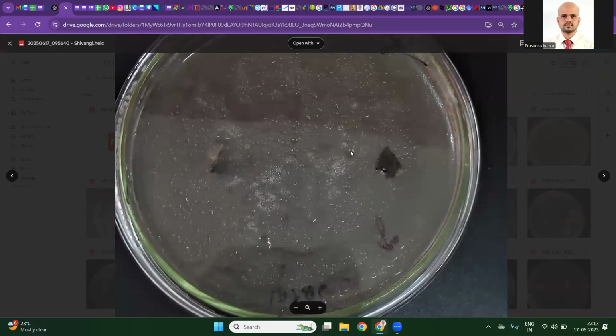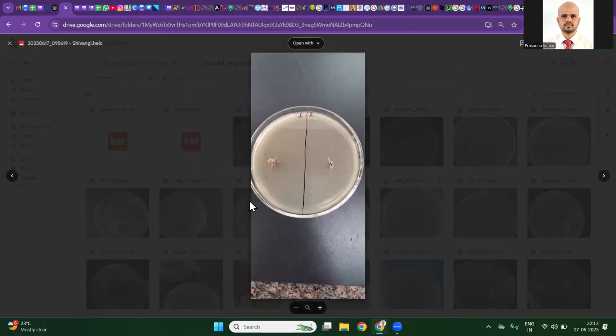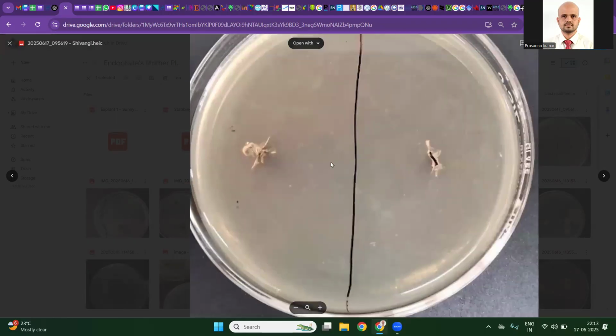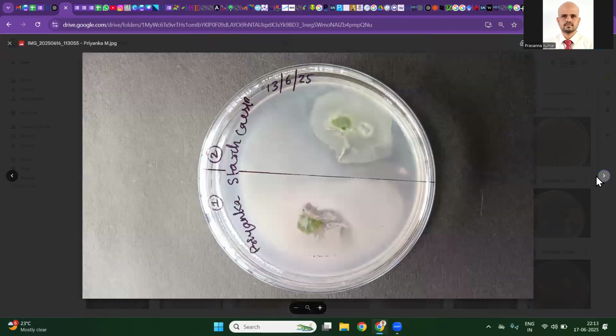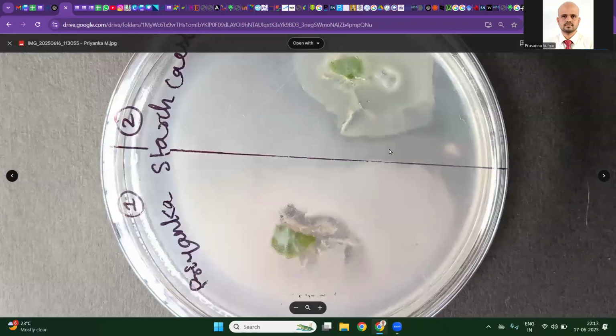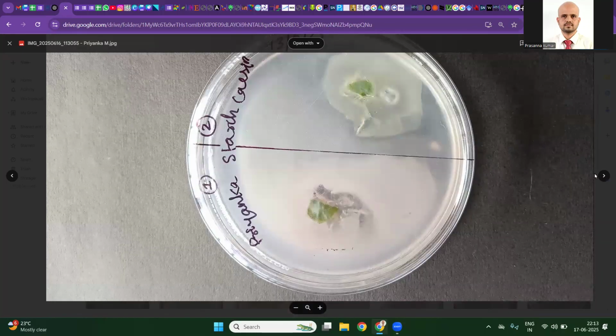You should not be having colony growth away from your explant. Again, the picture should be taken after cleaning the lid. Otherwise not much interpretation can be done. Here, something may be coming out. Let them come out prominently, and then tomorrow you can go for pure culturing. If the imprint is clean, we may call them an endophyte. We have to check with the imprint plate.